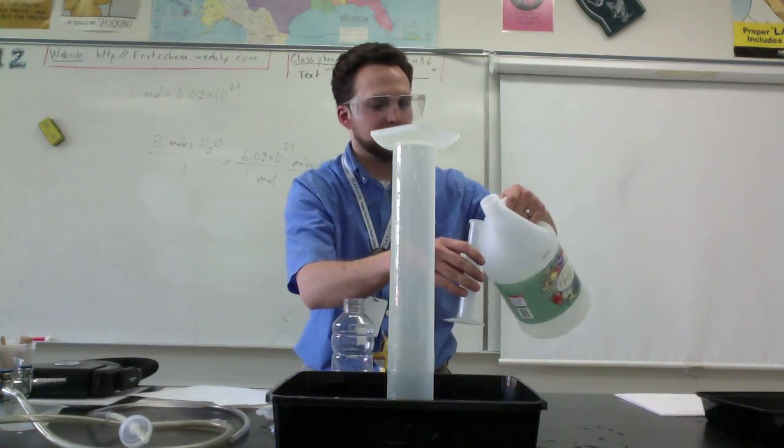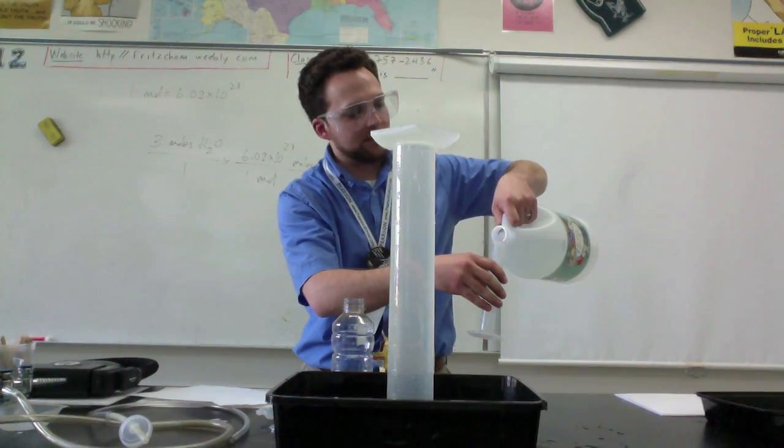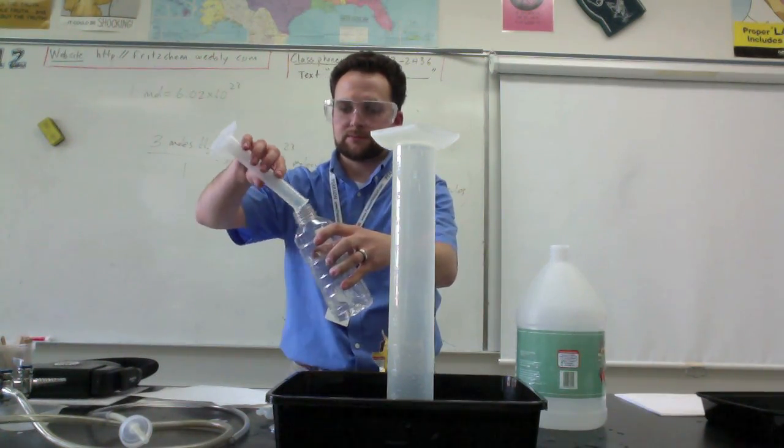Maybe I'll add a little bit more, so probably anywhere around 50, 60 milliliters or so, depending on the size of your bottle.